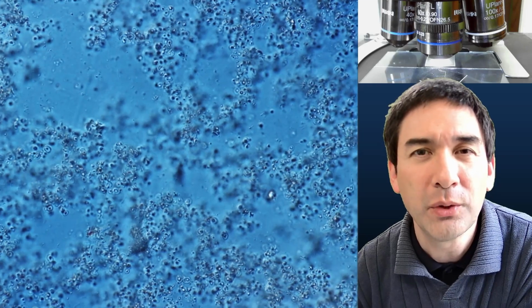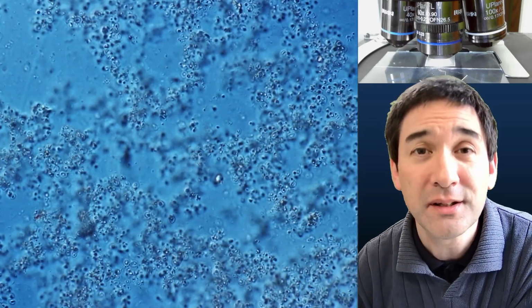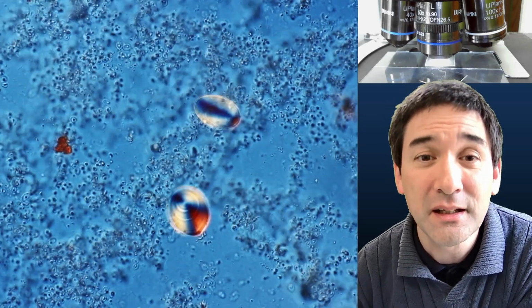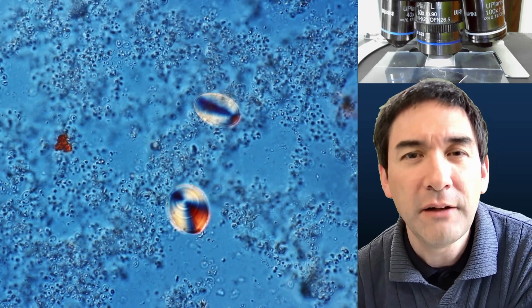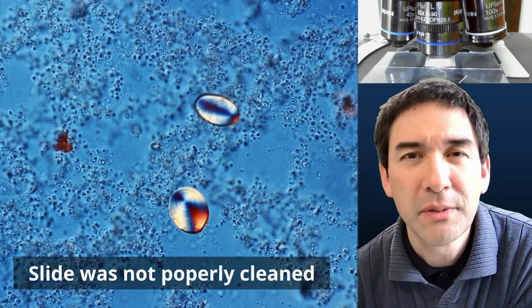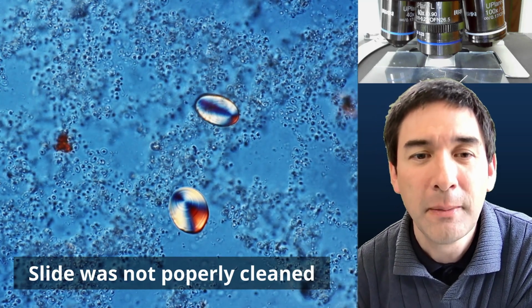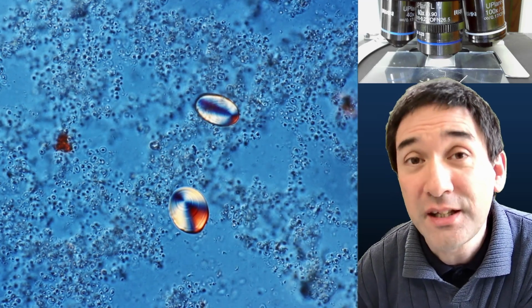Okay, what we have here looks like cell fragments, maybe several bacteria that started to decompose the yeast cells. Wow, interesting. These are starch grains. How in the world did they find their way on here? They must be some kind of a contaminant, maybe on the microscope slide. But I would like to show you now some fresh yeast cells under the microscope.